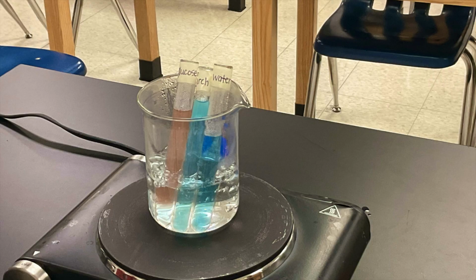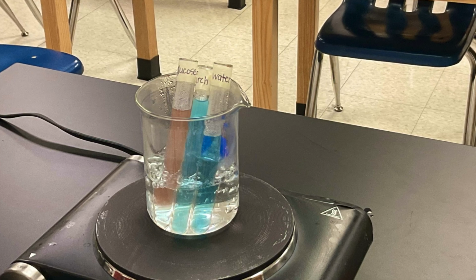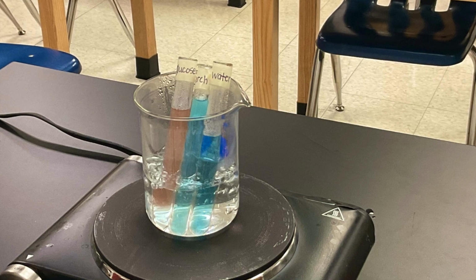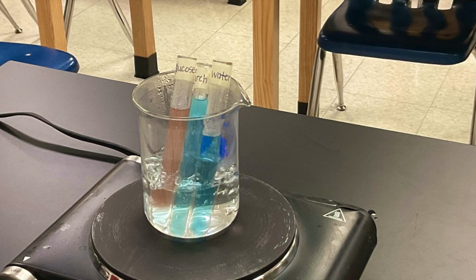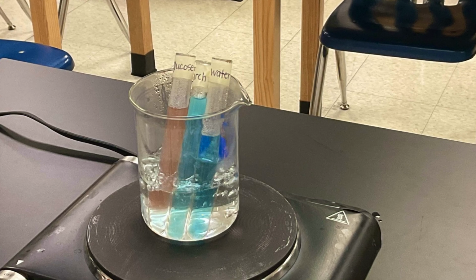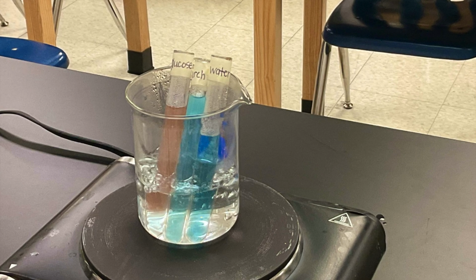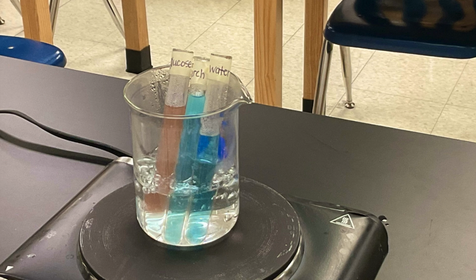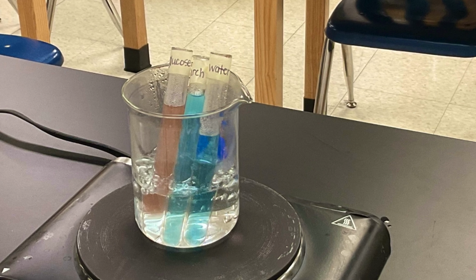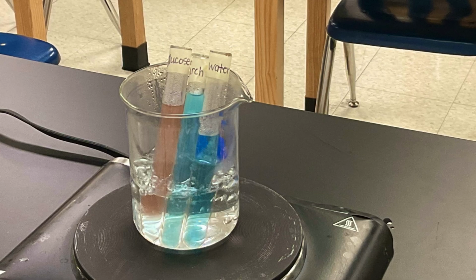While we continue to wait for a change in the dialysis tubing, let's focus back to beaker number 2. This is where we're testing for glucose with Benedict's. Pay attention to the test tubes with the solution. Look at the color. Has it changed? You can notice that the beaker solution changed from a bright blue to a pinkish red. This shows that glucose was present in the solution. Don't forget to record your observations on your data sheet.